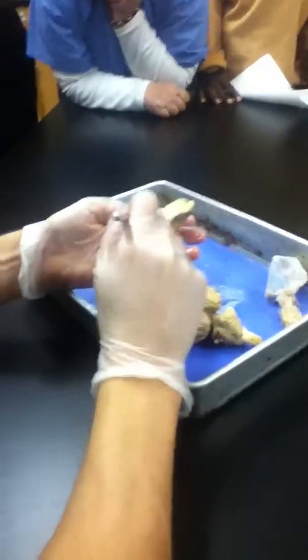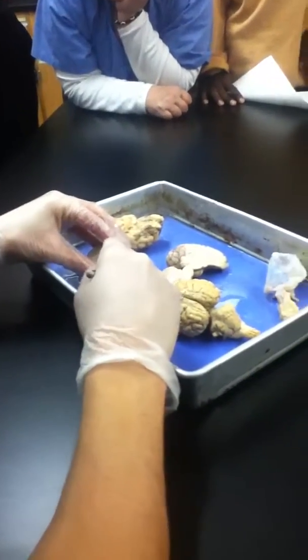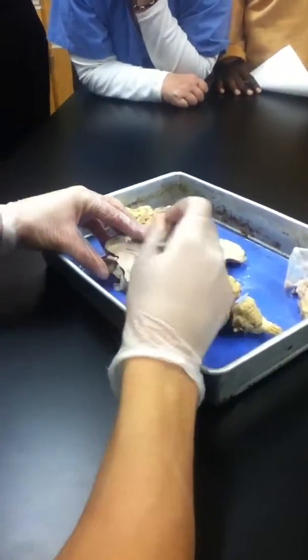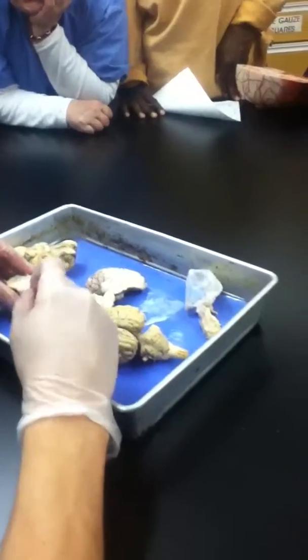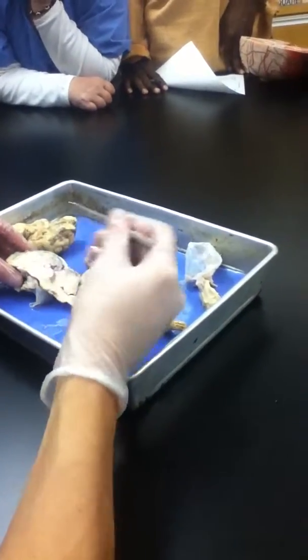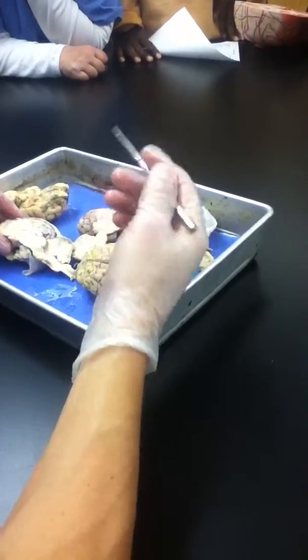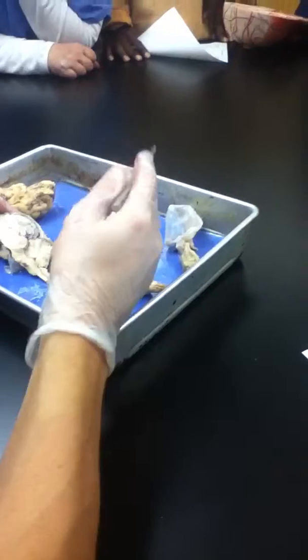Okay, none of these have the pineal gland intact, and that one is not a common thing for me to ask anyway, because it's rare that it is intact. But where there was thalamus and hypothalamus, you sometimes find a little round gland sitting right back here. That's the pineal gland. Neither of these halves have it intact. Maybe come review day, as we get closer, we'll see if one has it better. But that's it for those.